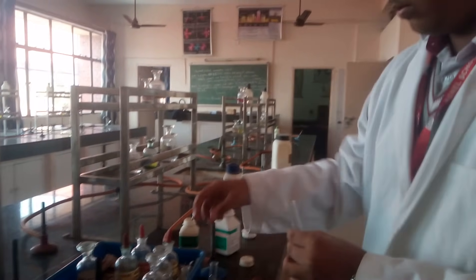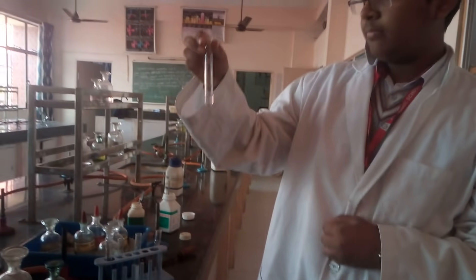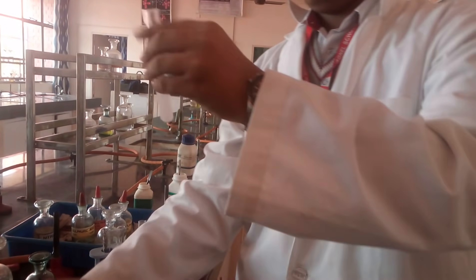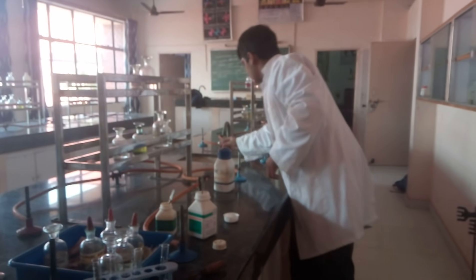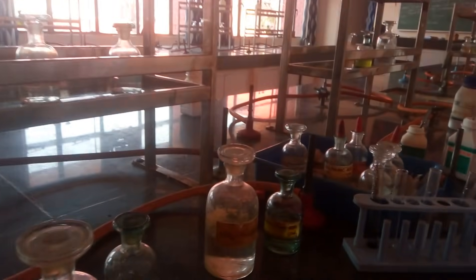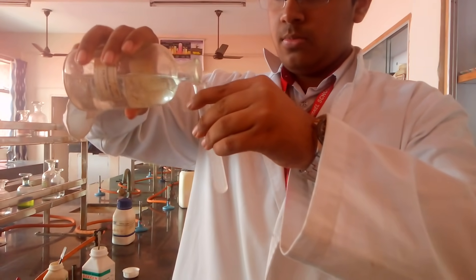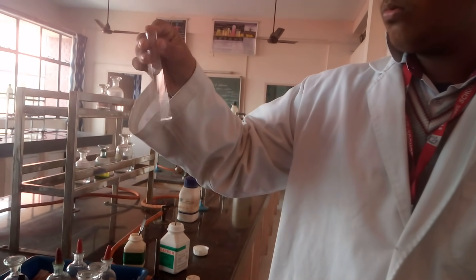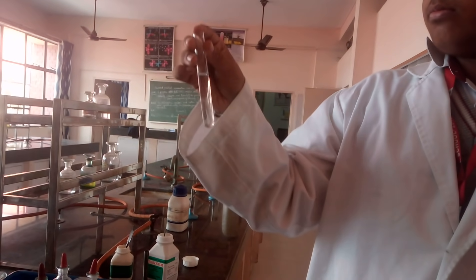Doing the second confirmatory test. You will again use the second part of the original solution. To this we will be adding lead acetate solution. You again get a white precipitate — with lead acetate you get a white PPT. We now need to check for solubility. Discard half of it since the aim is to check for solubility. The solubility is to be checked in ammonium acetate solution. It's becoming clearer — you need to add a considerable amount with the aim to dissolve it. It would dissolve if it is sulphate. With that we get the confirmation of sulphate.